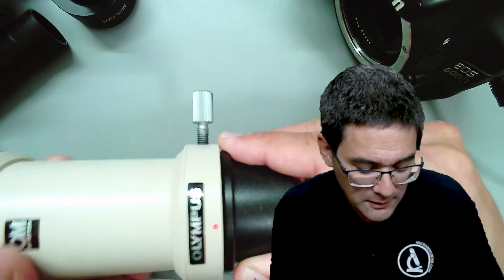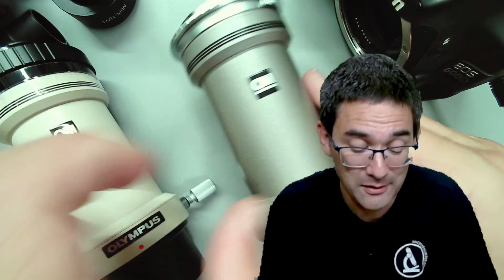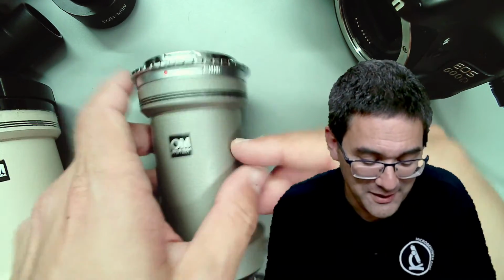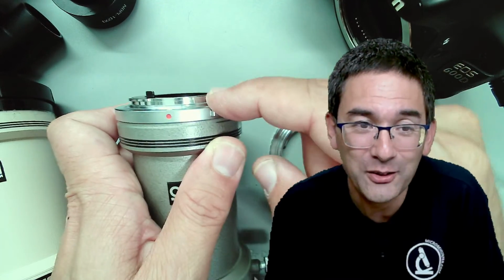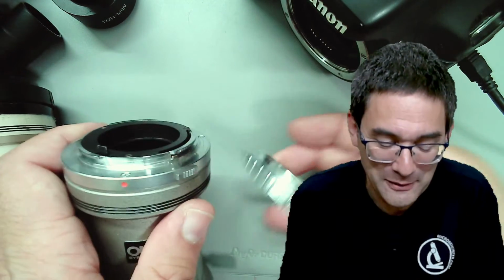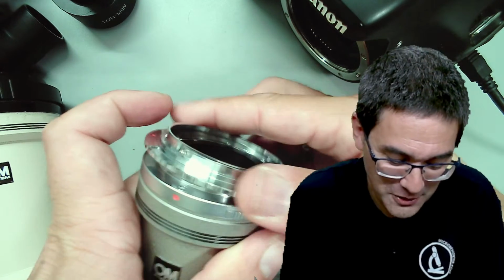So I'll put this back here. I just want to show you another one over here. It looks exactly the same. But it was a headache, honestly, when connecting it. You think it looks the same, just the color is different, but there is a difference here. Look, this is an Olympus mount. There is no T2 adapter possibility here. So how do I get an Olympus mount on my Canon camera? Luckily, I found an adapter ring that converts Olympus to Canon. So that's basically the solution here.